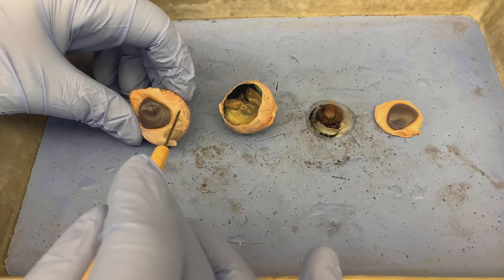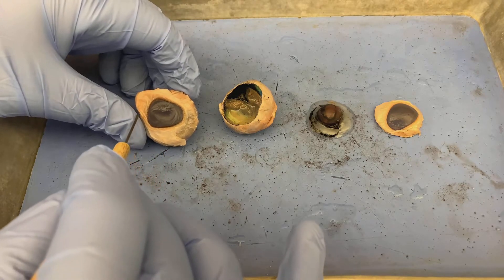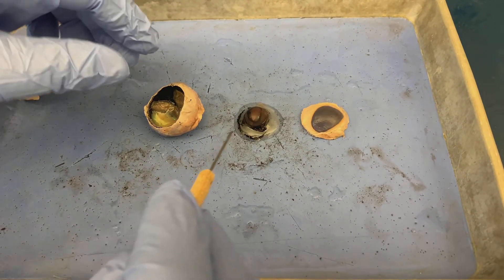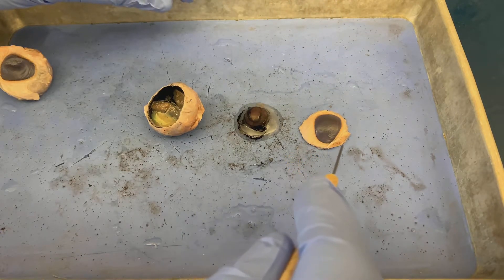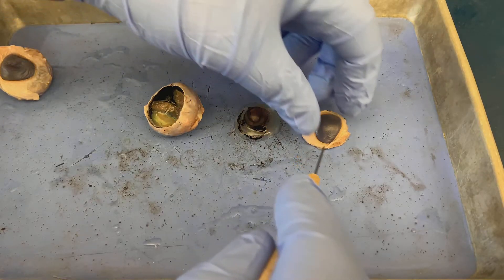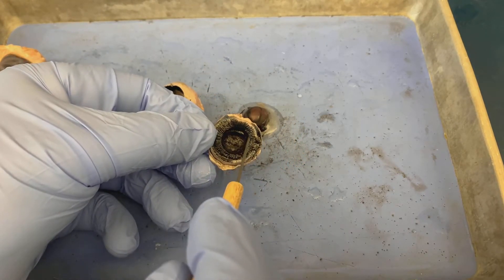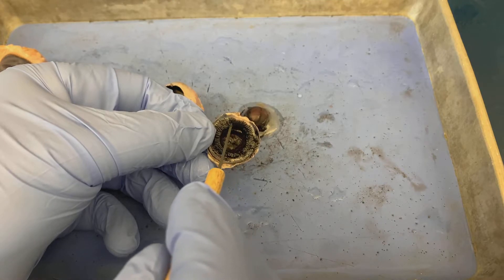The dissection was done by cutting a few millimeters posterior to the actual cornea, cutting around that cornea. We're left with three structures — three portions of the actual eye. We've got the front part of the eye, which is the cornea with a portion of the sclera surrounding it. Posterior to that view, if we flip this over, we'll see ridged-like structures around the periphery — these are known as the ciliary bodies.